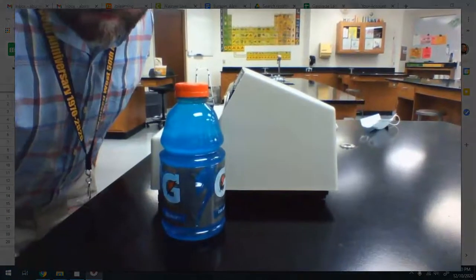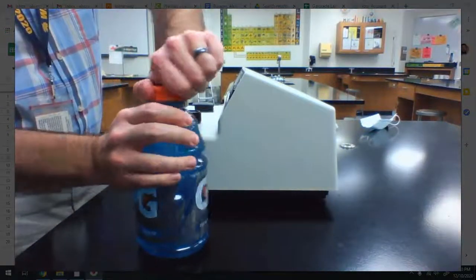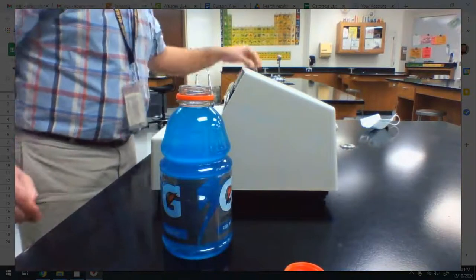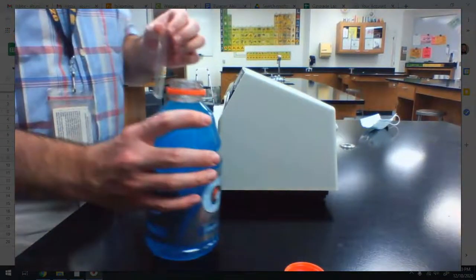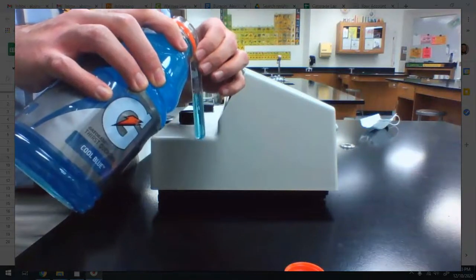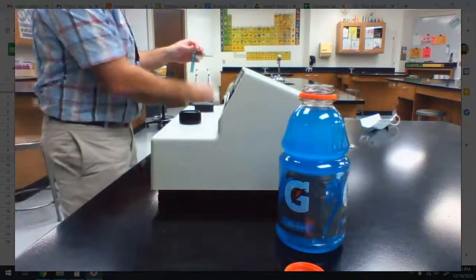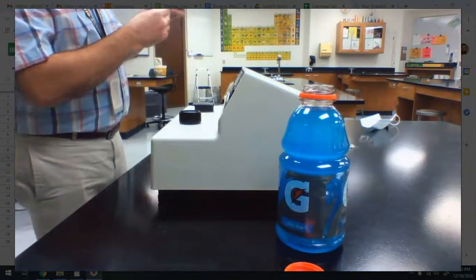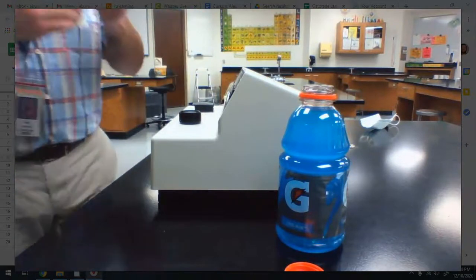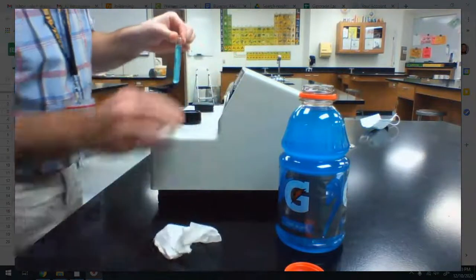All right. So here I am. I've got my Gatorade. Let's crack this thing open, and let's get a measurement. My instrument is still zeroed. I have reset it up. So now I'll pour some Gatorade into the cuvette. It wasn't too bad. I just spilled a tiny bit. Okay, and we will wipe it down, make sure there's no fingerprints on there like we always do. And we'll put this in the instrument.